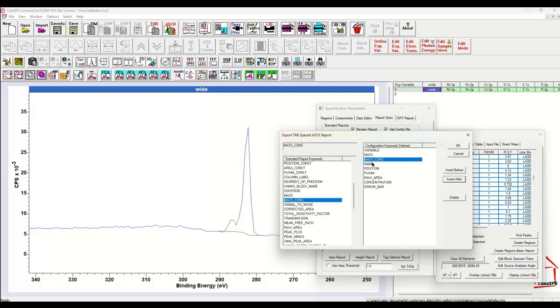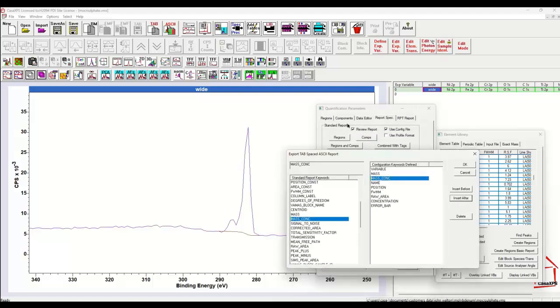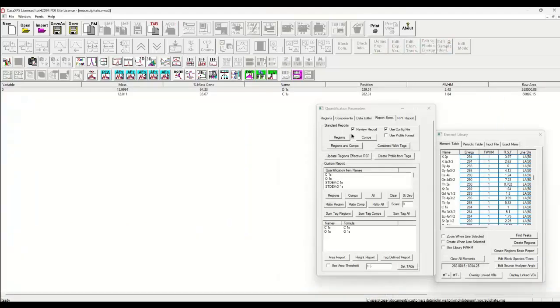That means to work with mass, I need to create a new configuration file. But for the moment, I just want to verify that what I've created in my regions does indeed have the correct mass for oxygen and for carbon. So when I press OK, the report comes up, and I can see I've got oxygen and the mass is 16, and carbon and the mass is 12. So everything is working as it should be. So these two fields within the configuration file help you verify that you've got the right information to calculate a mass concentration.